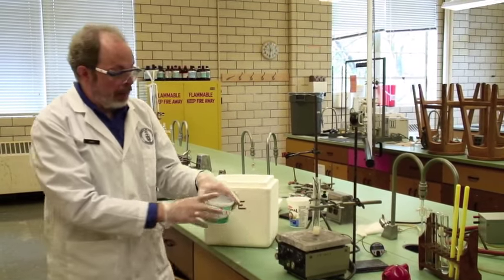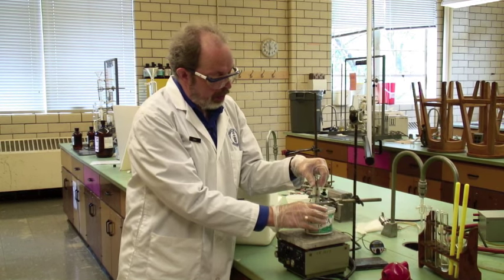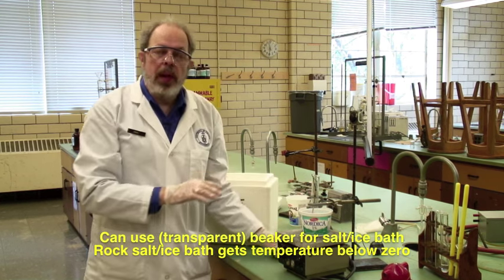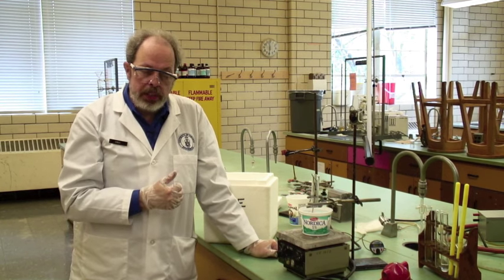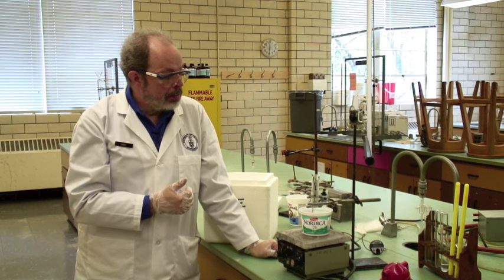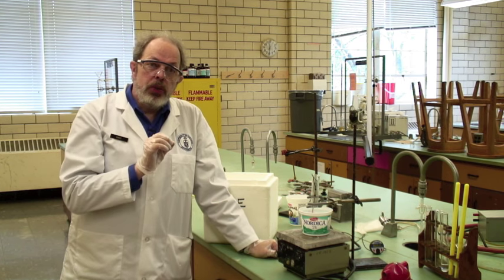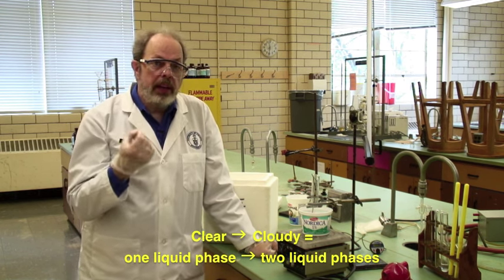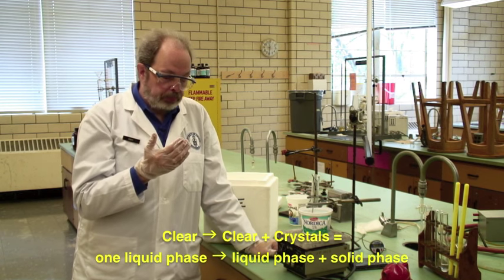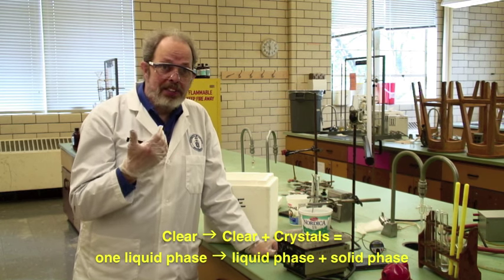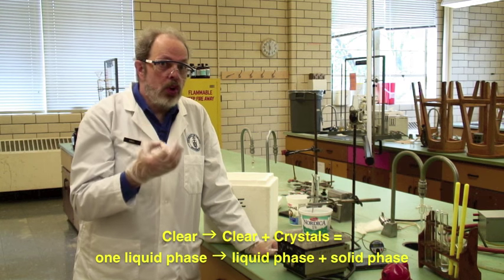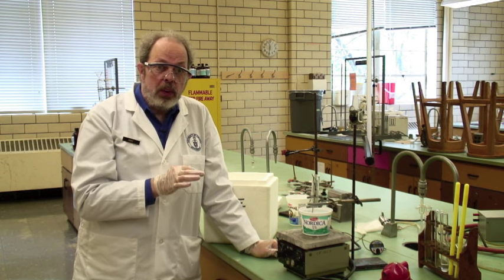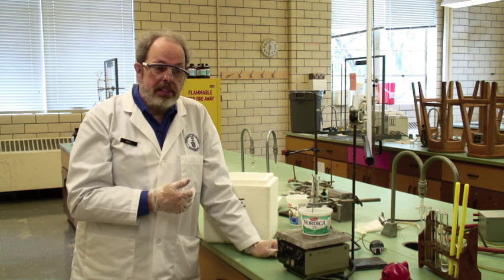Add the salt as it goes in. Add some water to this and then put the entire bath around the phenol. Now, you need to have the rock salt enough out of the way that you can watch your sample. So add a little liquid to that. It might be easier if you used a glass ice bath. It's up to you. But what you are looking for is the second phase. In some cases, this will go cloudy. And that means a second liquid phase. In some cases, you will get crystals coming out. It looks like snow. And in fact, that's exactly what it is. It's either water crystals or it's phenol crystals coming out. But that's the second phase. And if you know which phase it was, it will tell you what portion of the phase diagram you're looking at.